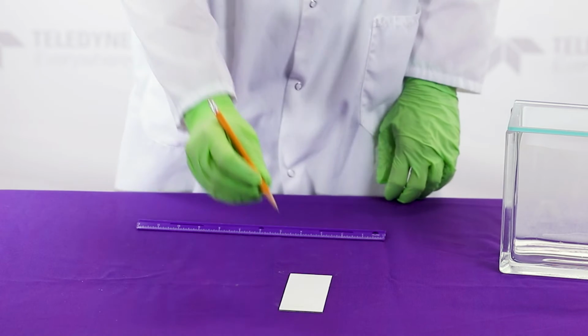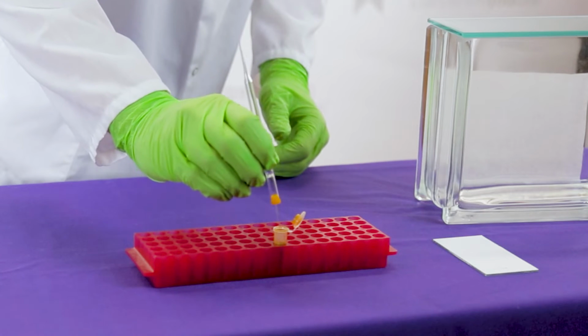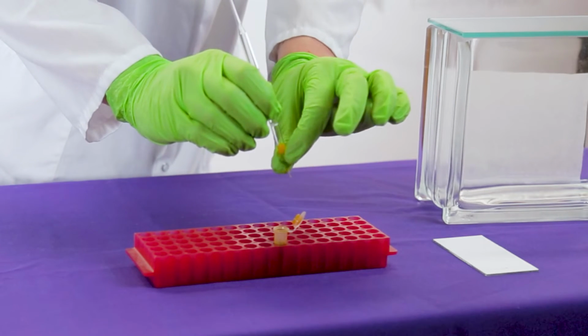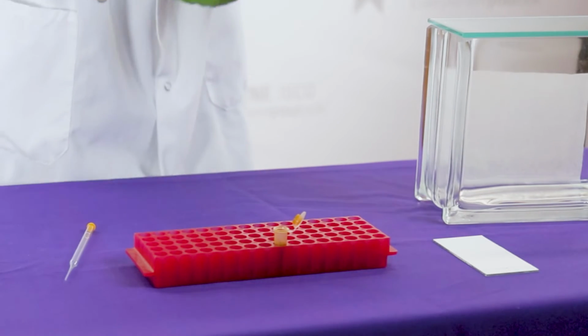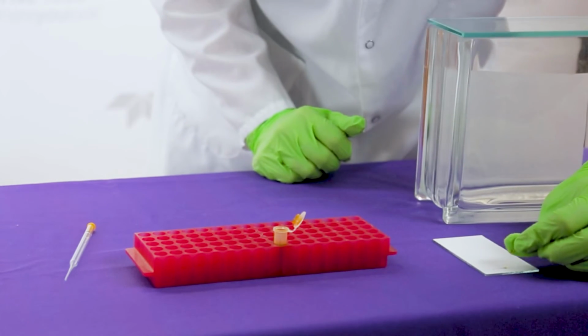The next step is to spot your compound or dye on the glass plate. In the center of the straight line you just marked, use the pencil to make a point. This is where we will be placing our dye. Take your capillary and place it carefully in your compound so you pick up just a small amount. Find the point you just marked on the glass plate and dot your compound onto the point using the capillary.